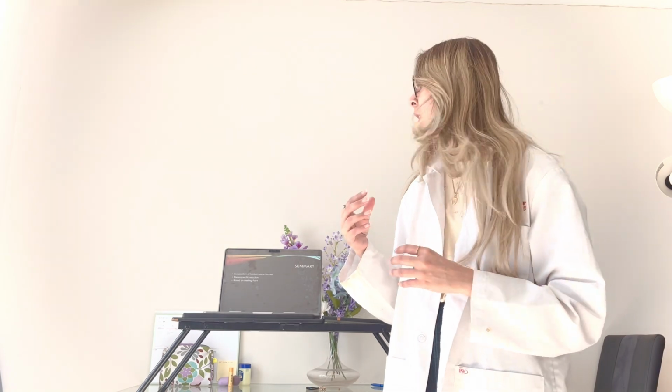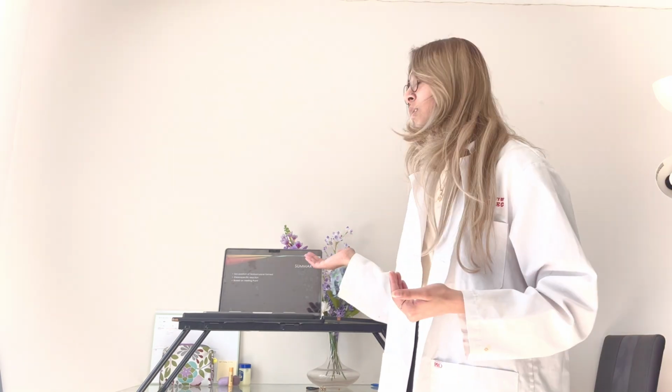We found that after letting the product dry completely, the melting point was found to be 109 to 110 Celsius, which is closest to the exo position that we saw there. Hence our hypothesis, that the exo position would be most favored due to our knowledge of steric hindrance, was true. So the experiment overall was a success.